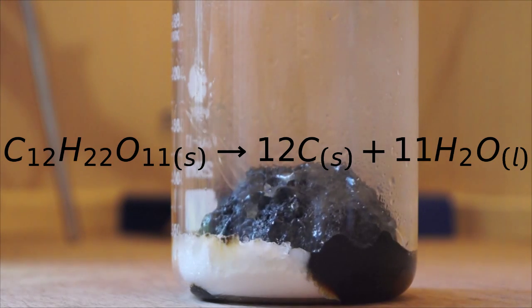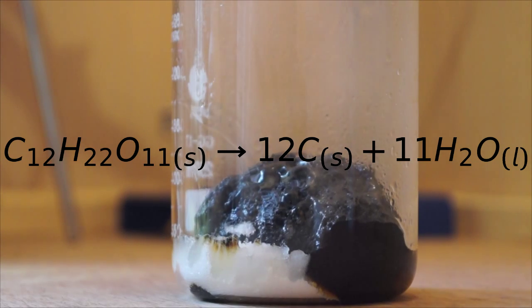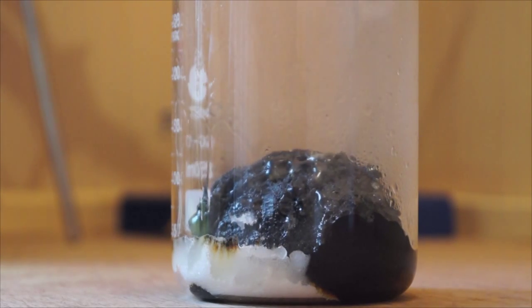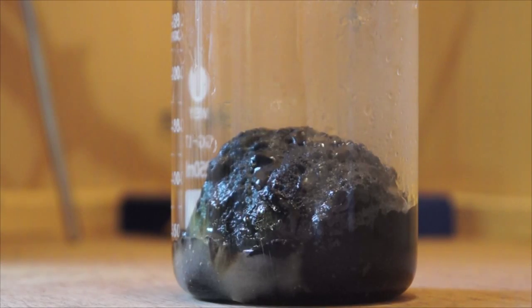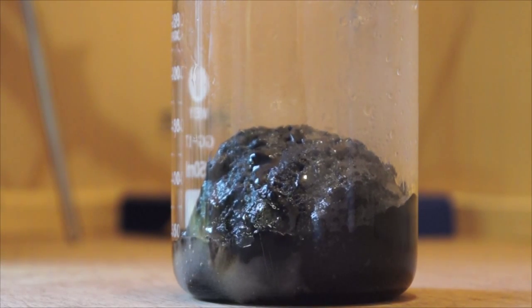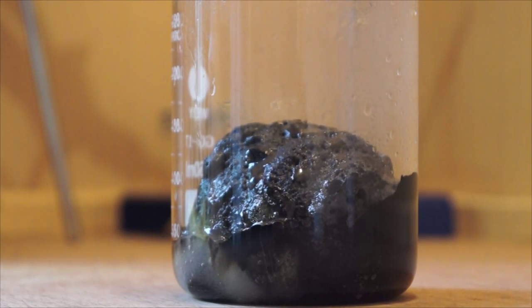The reaction is extremely exothermic as you can see the water evaporating from the beaker. Due to the high temperatures, some of the sulfuric acid may have evaporated producing a toxic gas, SO2. Carbon monoxide and dioxide were also produced due to the oxidizing properties of the sulfuric acid which oxidized the carbon.